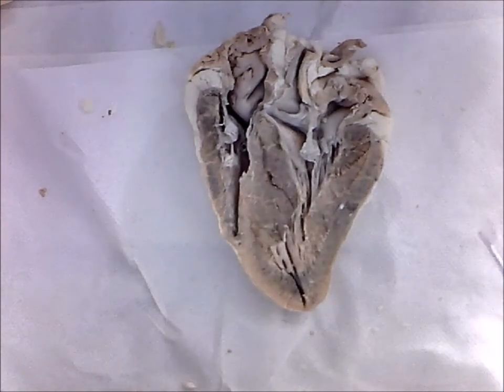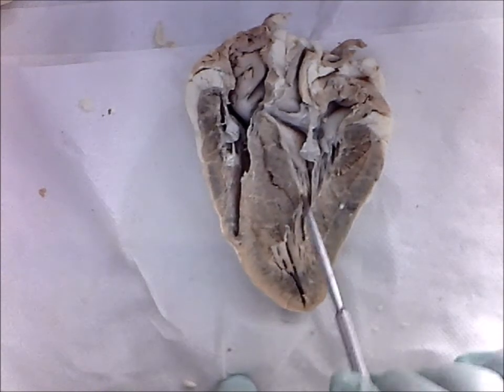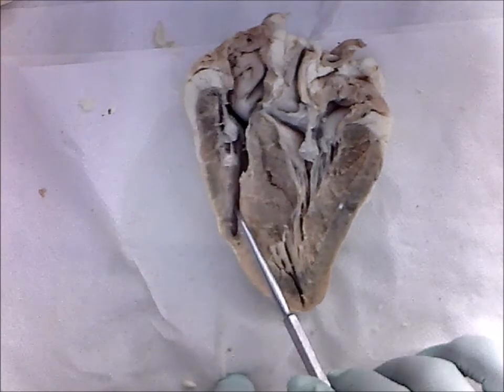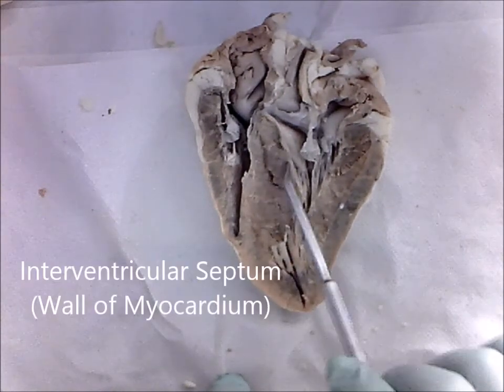Now, in between the two ventricles, there's the left ventricle over here. Here's the right ventricle over here. In between the two ventricles, you have this wall of myocardium called the interventricular septum.